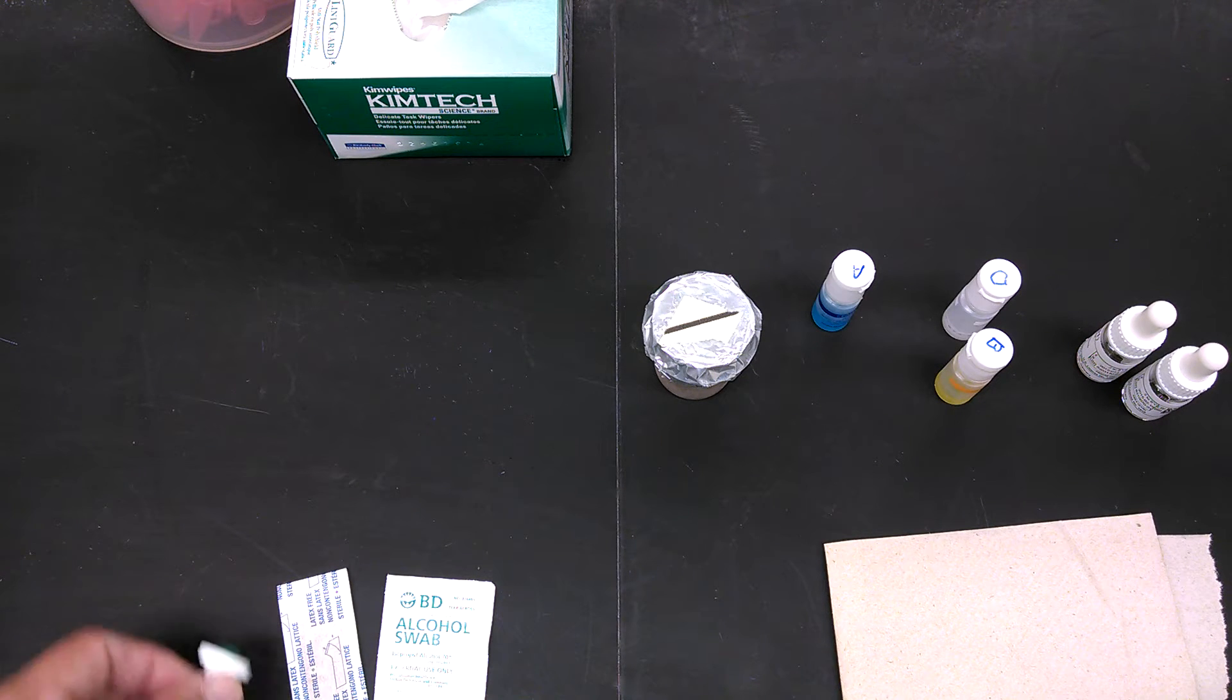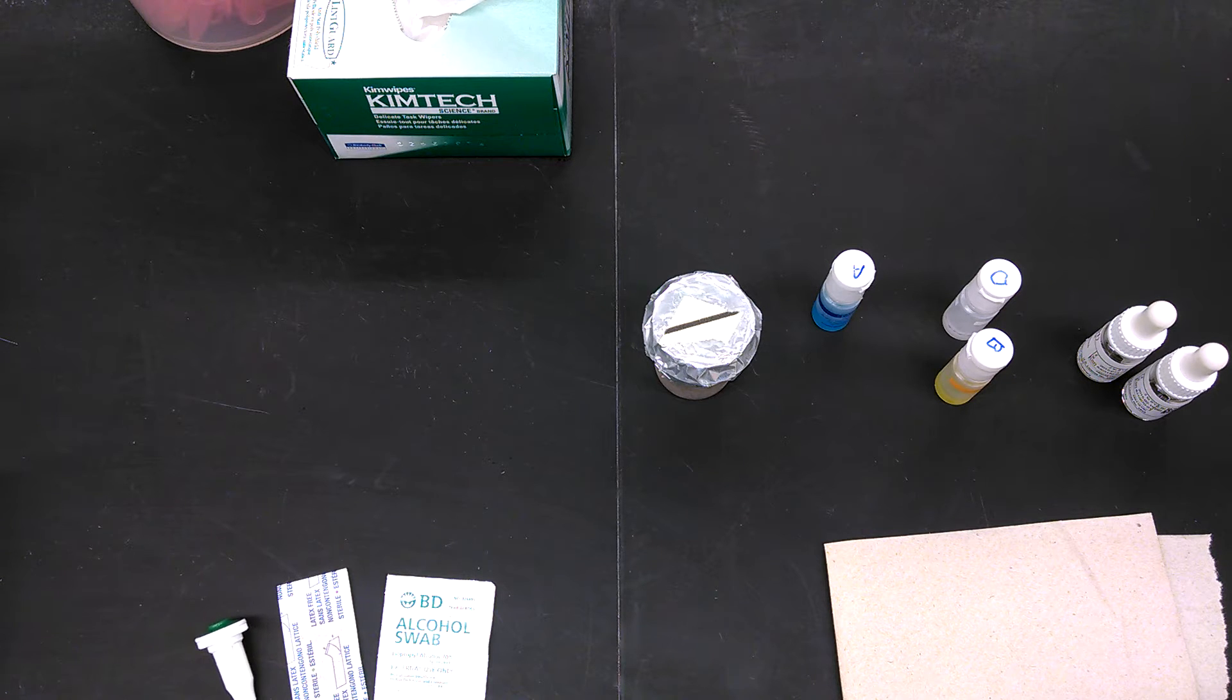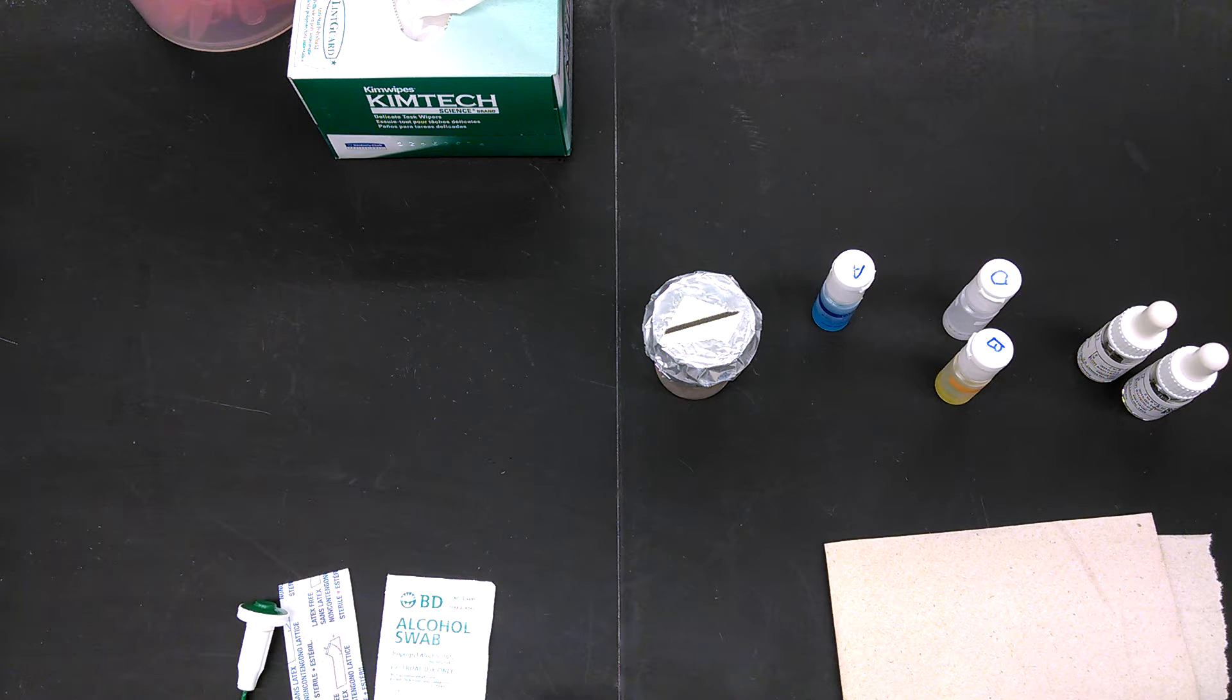This is a video for how to test your blood in genetics lab. I have everything set out here right in front of me for the video, but some of these things will be in different places in the lab when you do this.